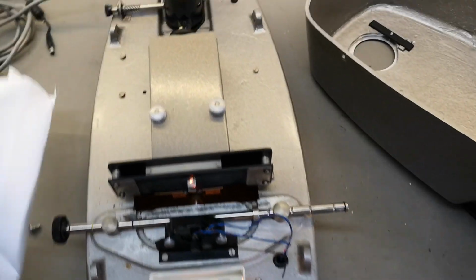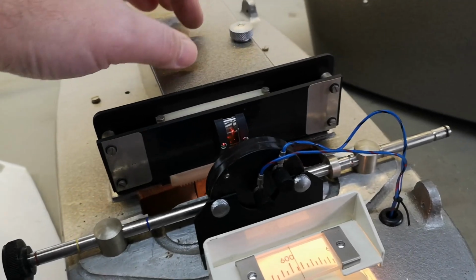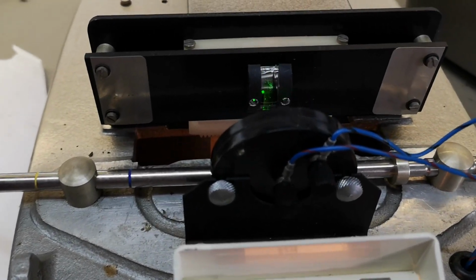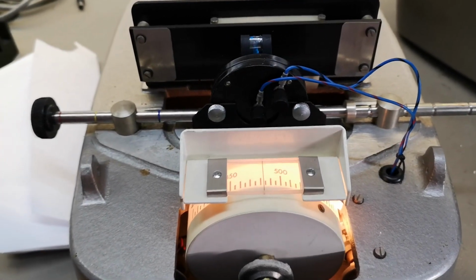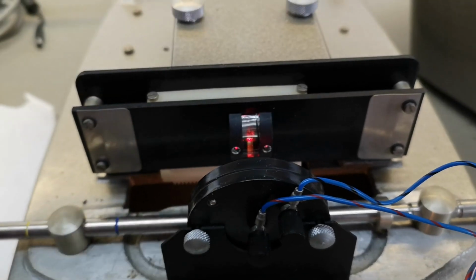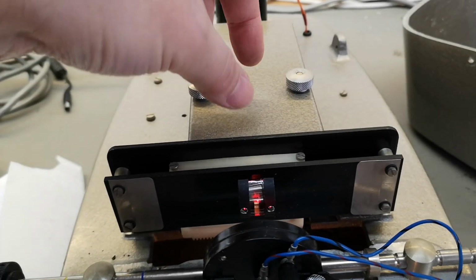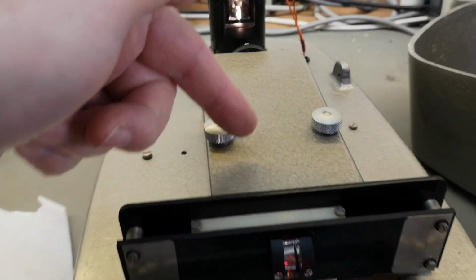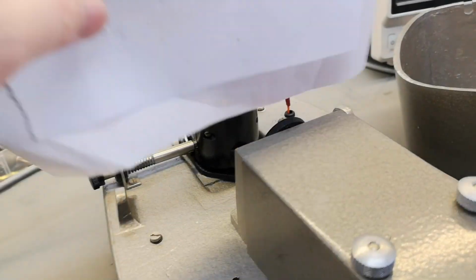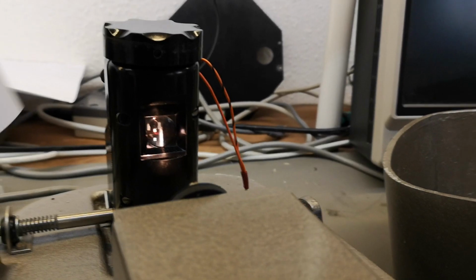And it actually works. What I figured out is there is only one light source. So it's in here. And then there's this moving filter. So see, when I dial here, I change the color here. So there will be some sort of a filter, a moving filter in here. I think we can open this and have a look. So the light source, there's also some sort of optics that beam up the light in a thin line. So that thin line goes inside this unit.